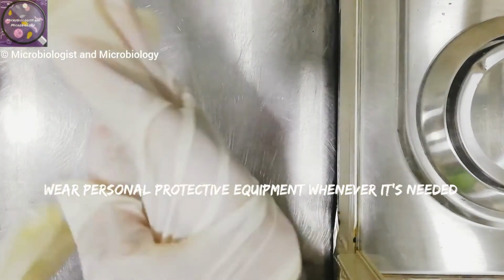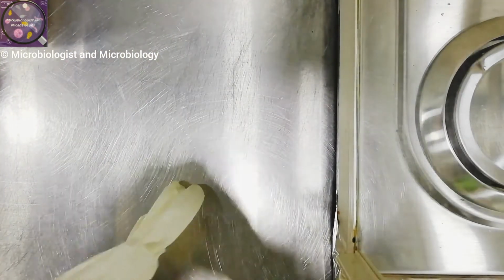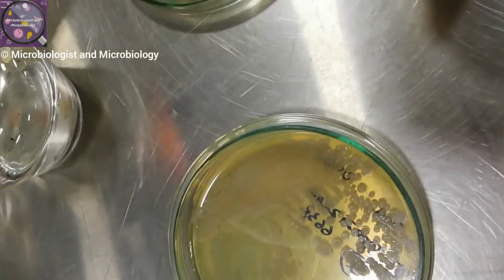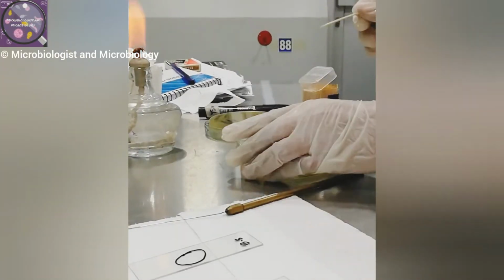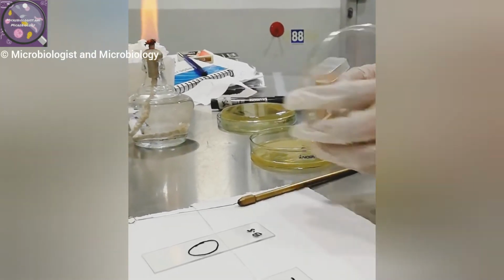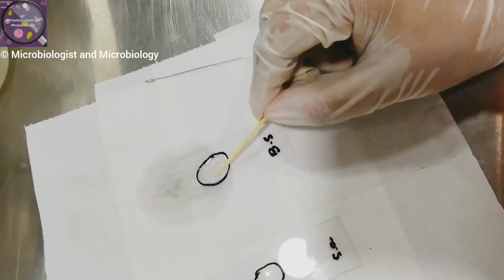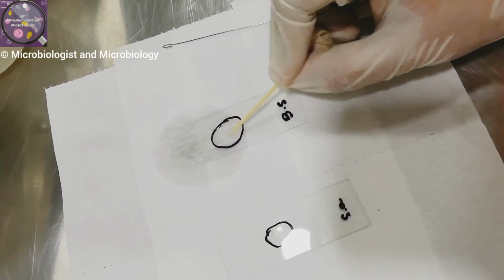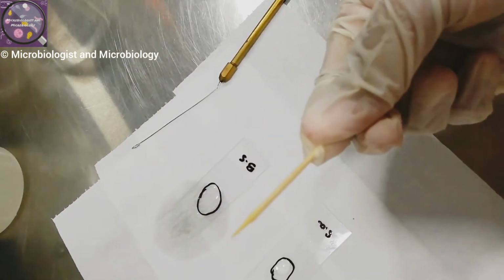Wear personal protective equipment whenever it's mandatory. In gram staining, it's not strictly necessary to wear gloves, but we should wear them to avoid contamination and hazard-related issues. First, add distilled water drops on both slides to make the smear easily. I am picking colonies of Bacillus subtilis with a toothpick and S. aureus with the help of a wire loop because I want to show both will work. I picked a colony of Bacillus subtilis and now mix it properly into the water. After adding the culture, I will discard this toothpick.